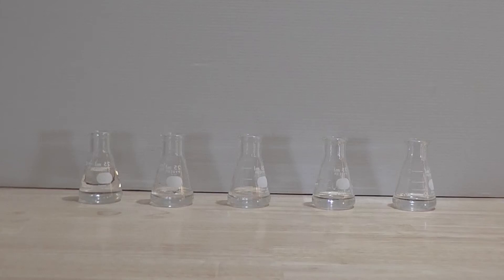I will demonstrate how to use a 1 molar solution of hydrochloric acid to prepare four diluted solutions of acid that have specific molarities. This particular experiment employs the principle of serial dilution, where I dilute each of the four solutions by a dilution factor each time, and use a standard volume each time.